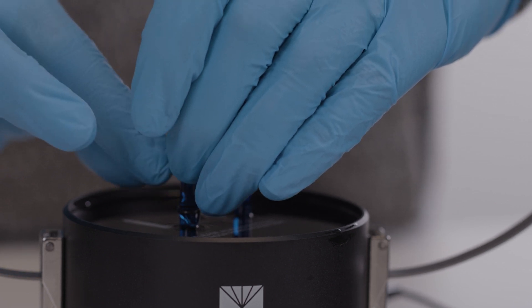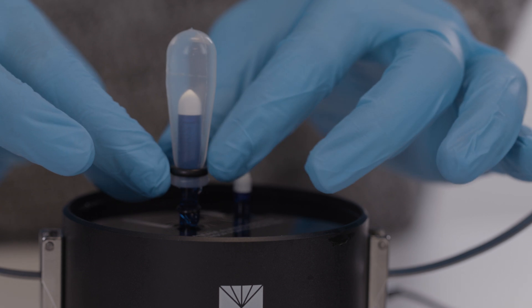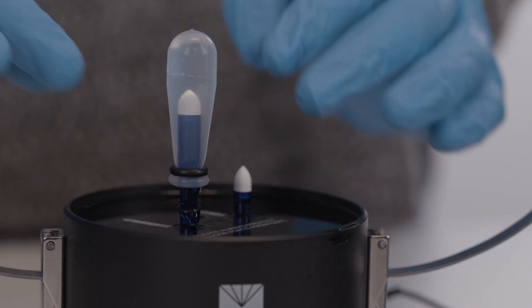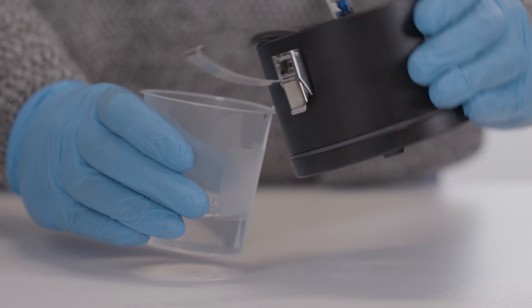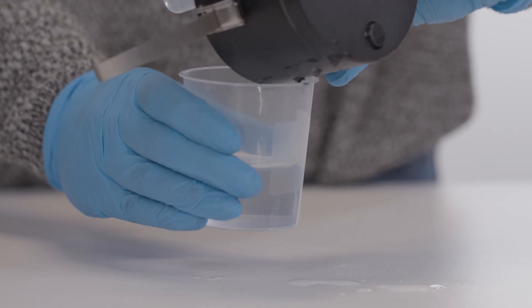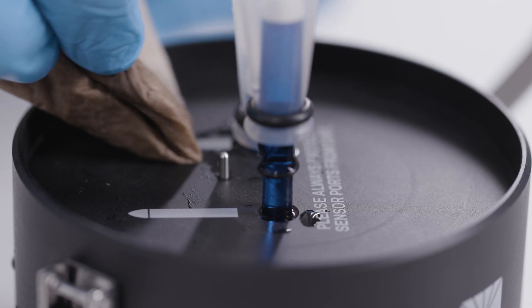Put the silicone cap back on the tensio shaft. Repeat these steps for the short tensio shaft. When done, close the wizard. Remove the excess water from the sensor unit and dry with a towel.